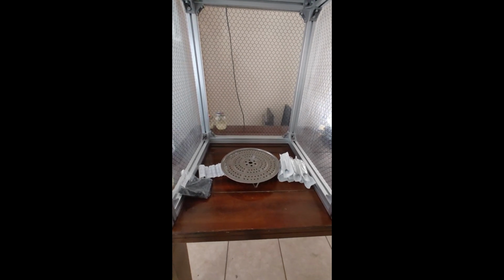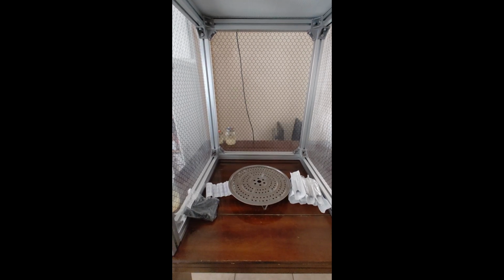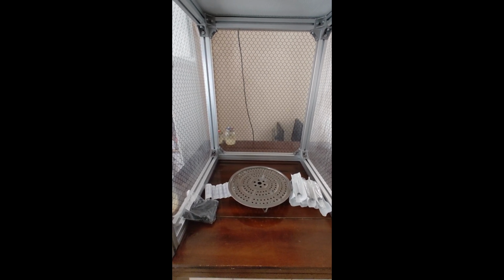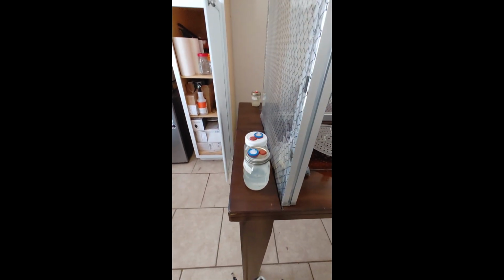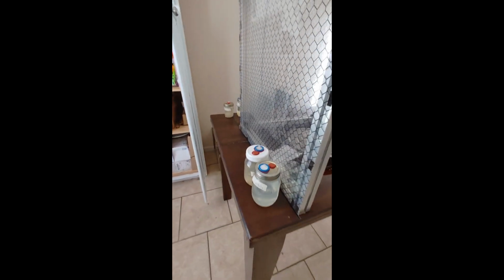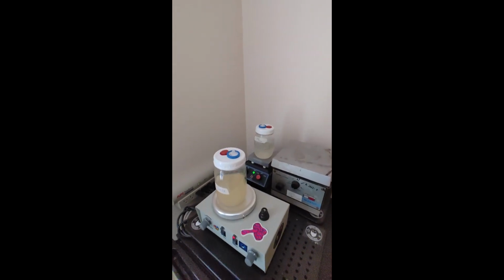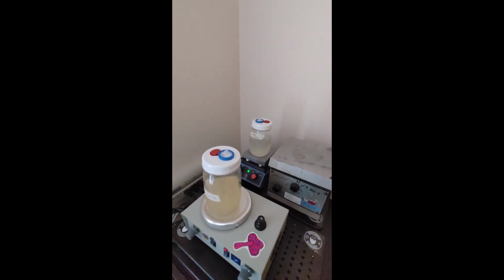All right, ladies and gentlemen, today's gonna be a loud one because the hood's running, but we're gonna make do. So today we're going to pull some LC from jars. First, we're gonna spin them. Now, if you don't have stir bars, this is gonna have to suffice, but I do have stir bars. So we're gonna take them from these magnetic stir plates and place them on that trivet inside the box.